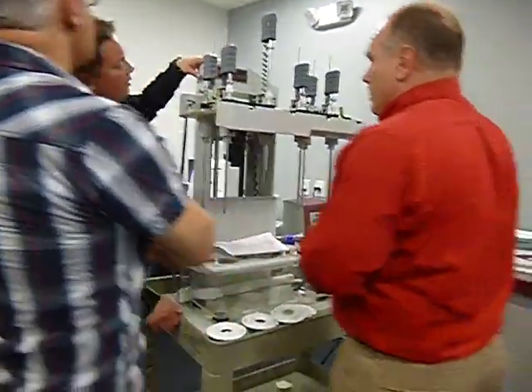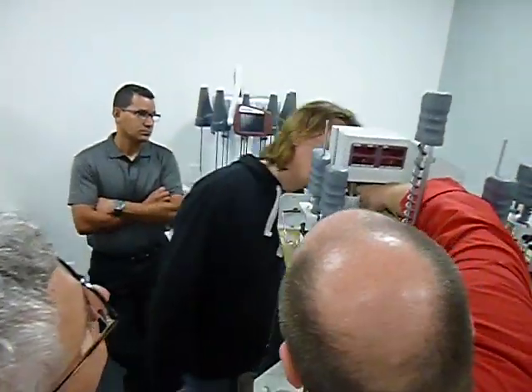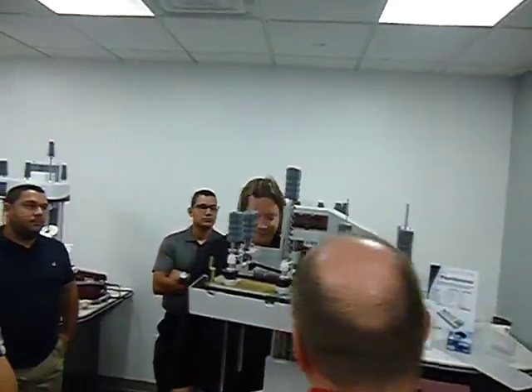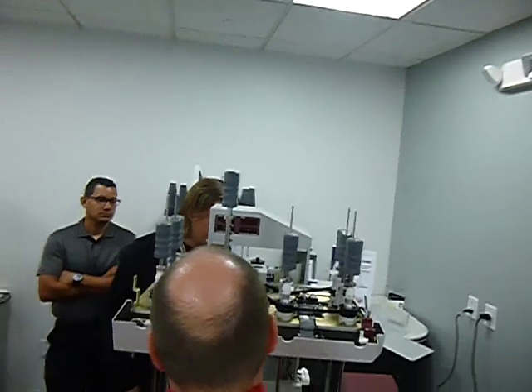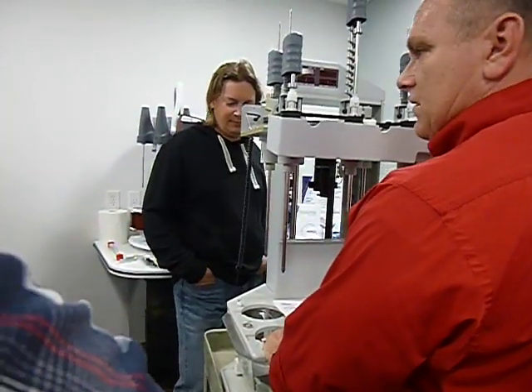So where's the cable for that? It runs up right back here. Come around. If you go on that side here, see, it's in that side here. Come here. Oh, you can feel it? Yeah. It runs up inside there. It's a ribbon cable.